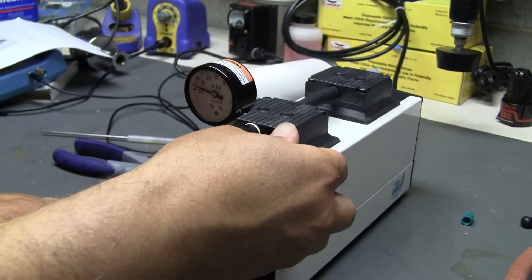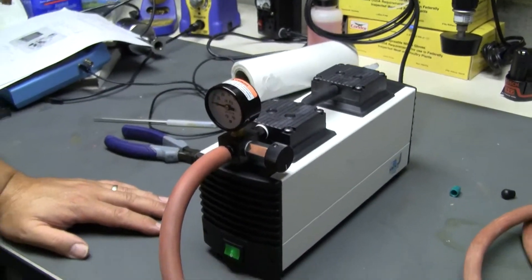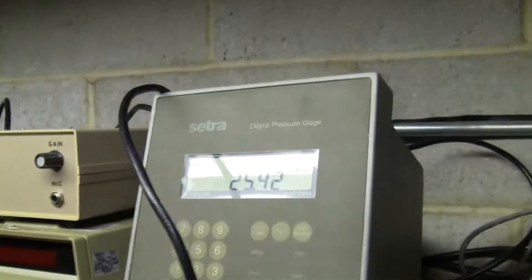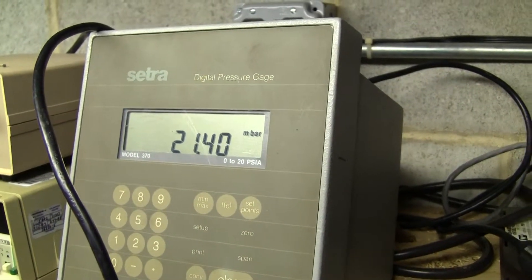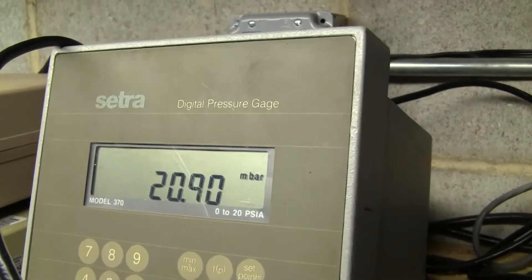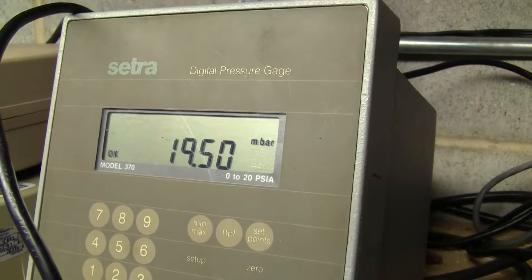I'm just going to shut it all the way off and see where this drives down to. Up on our gauge. 20 millibar, 19. Perfect.